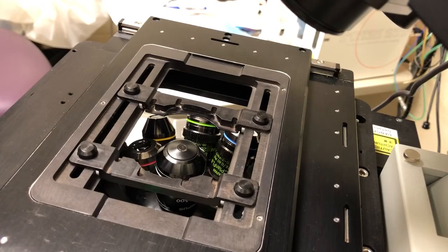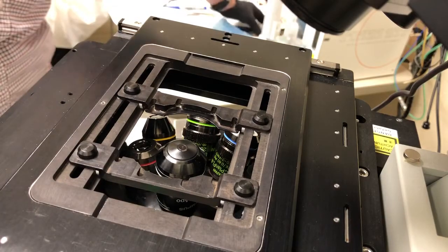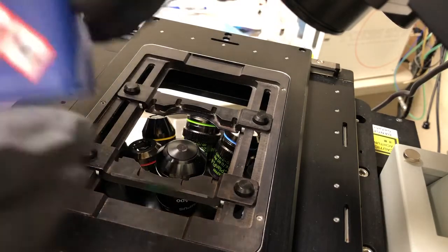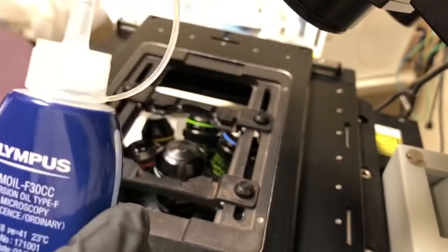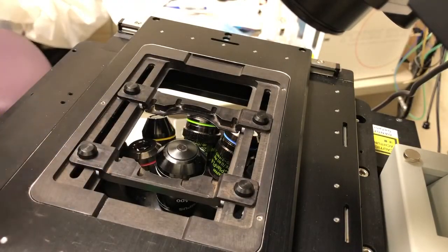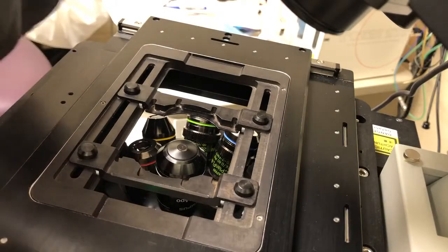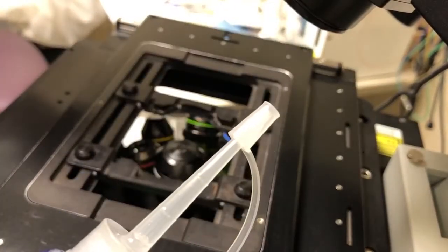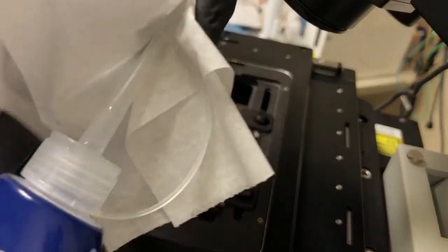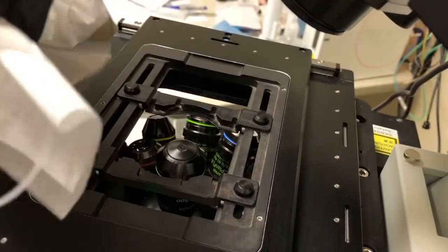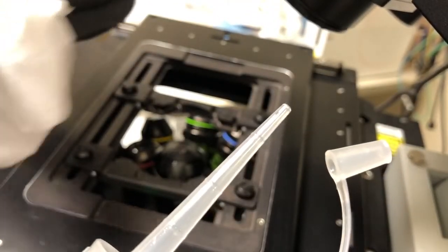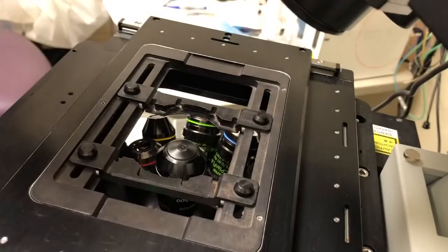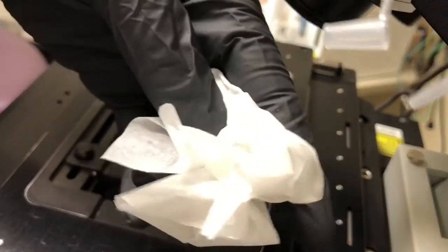Let me show you how to oil the objective and put on a sample. There's Olympus oil on the table next to the microscope, and you'll also need a Kimwipe. You'll need a Kimwipe because this oil dispenser has a little tip that's convenient for accessing hard-to-reach areas, but the problem is this tip tends to form bubbles, so you'll need to remove any bubbles when you apply it.